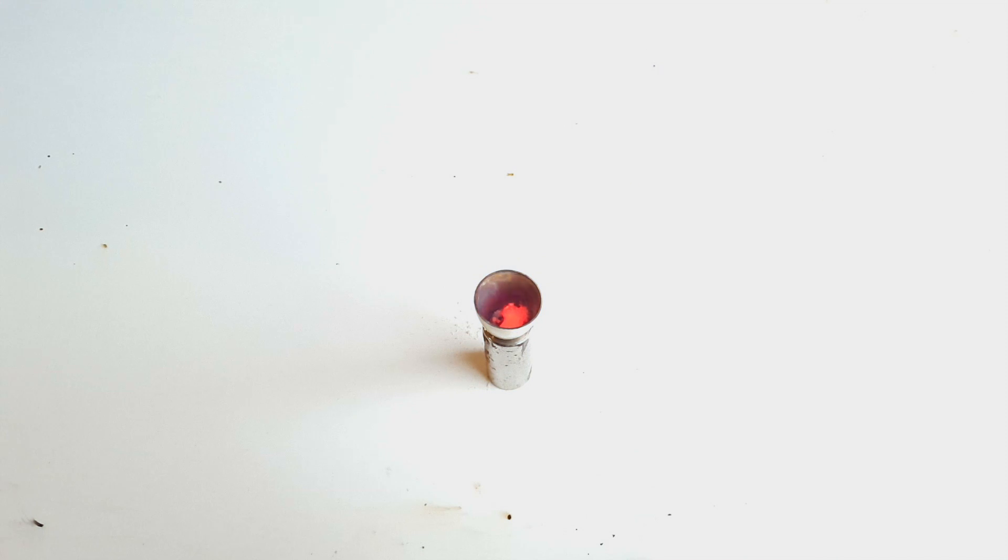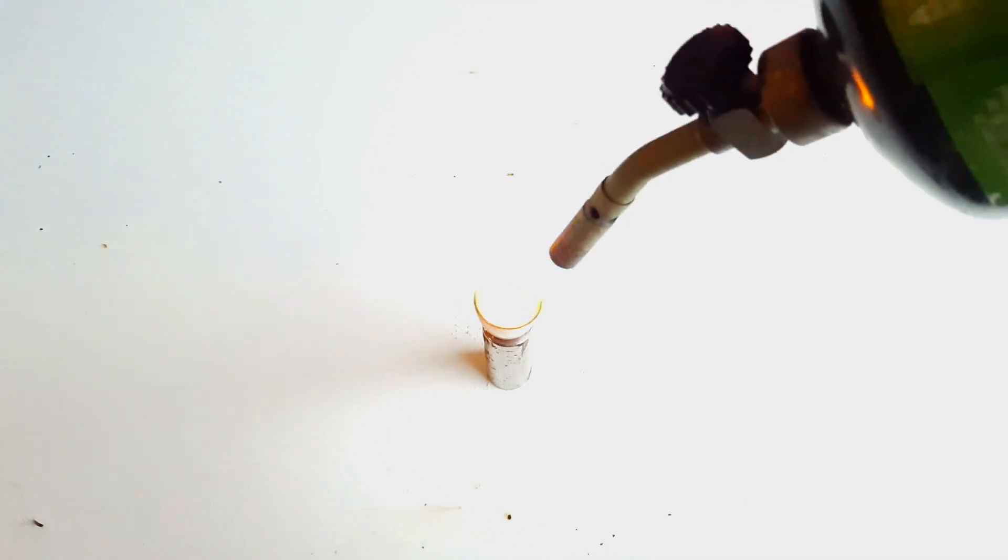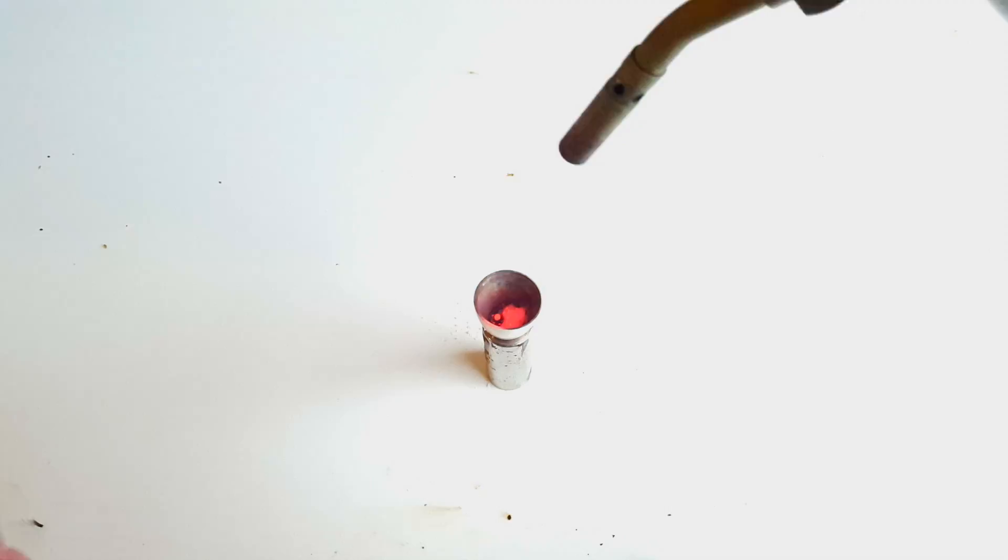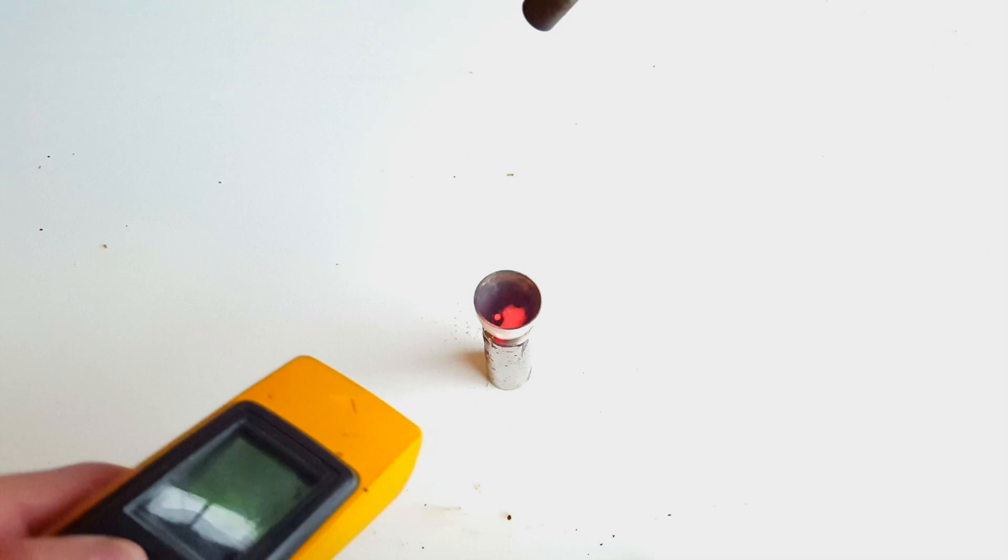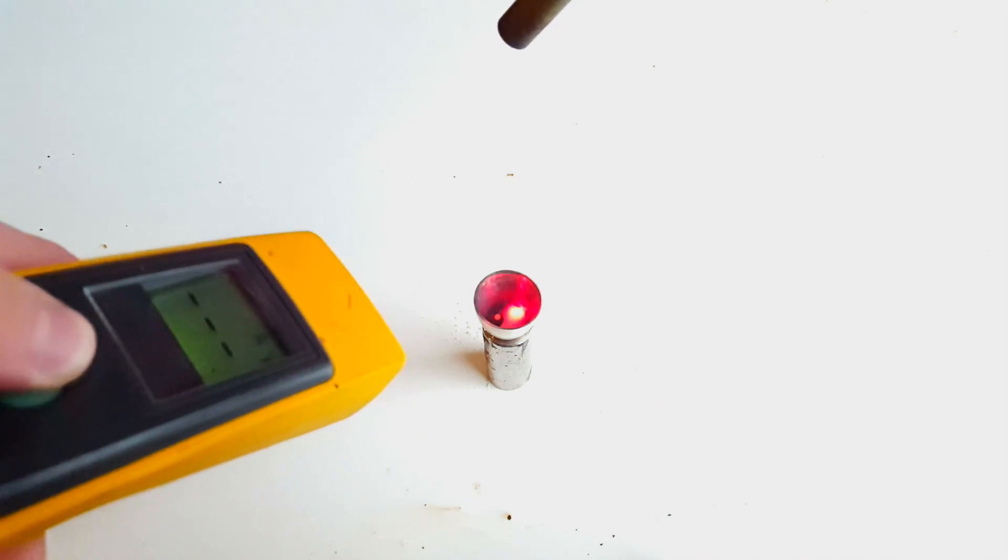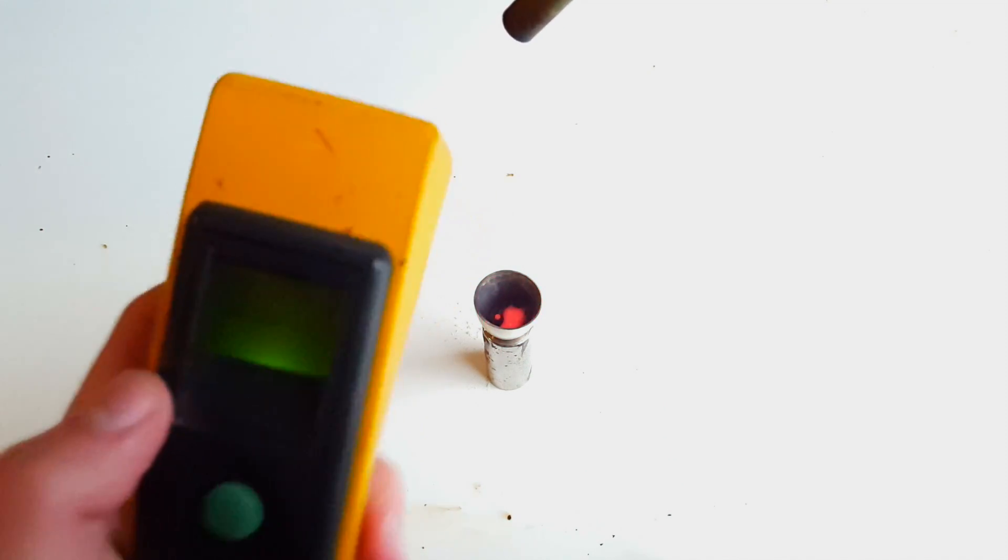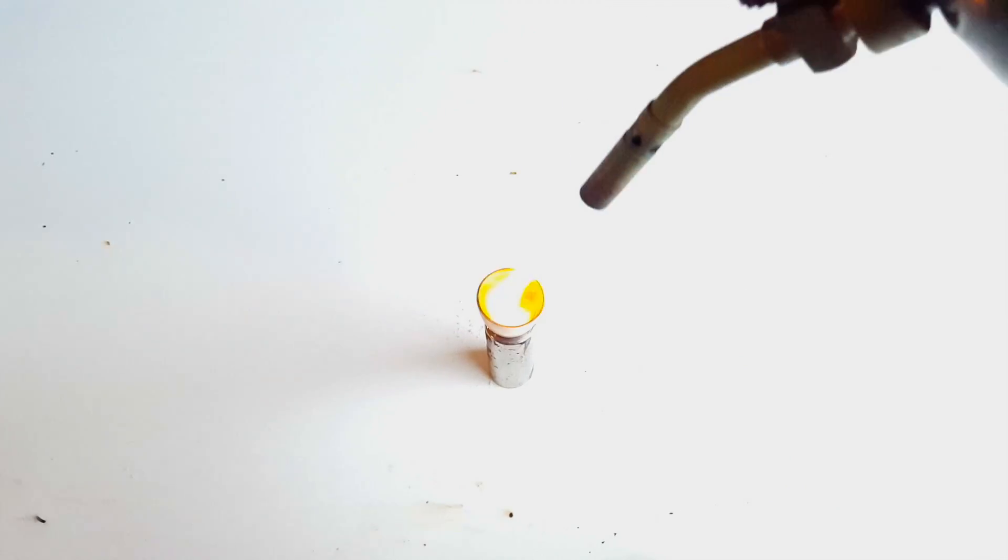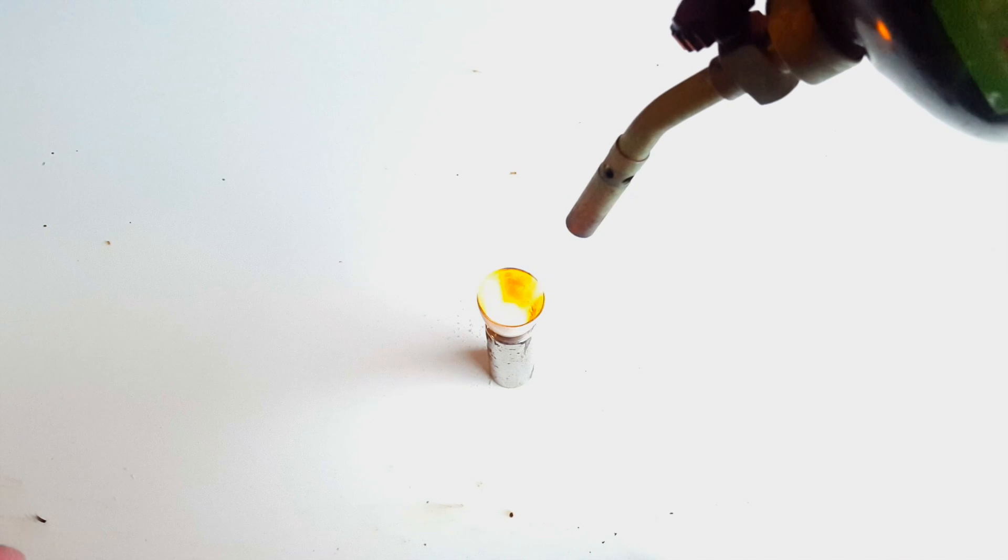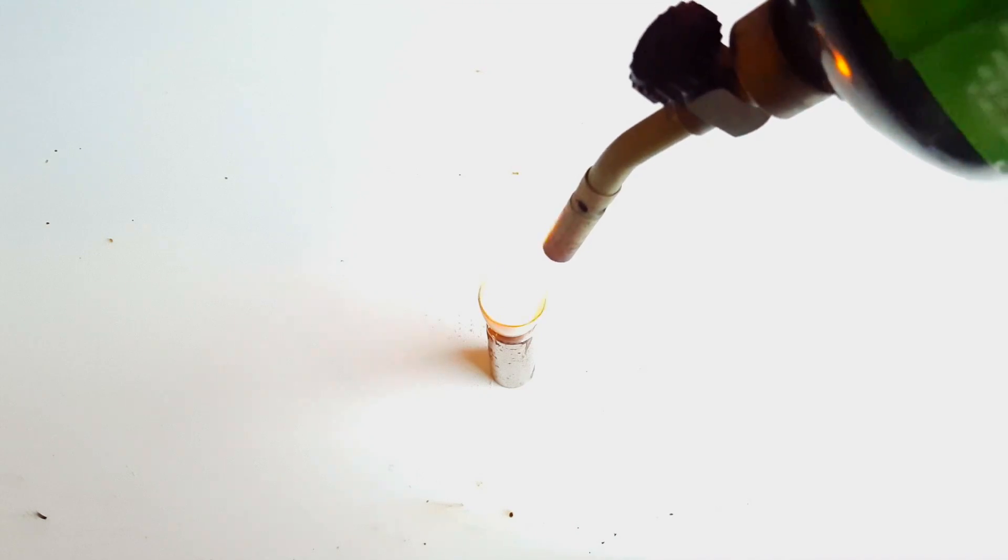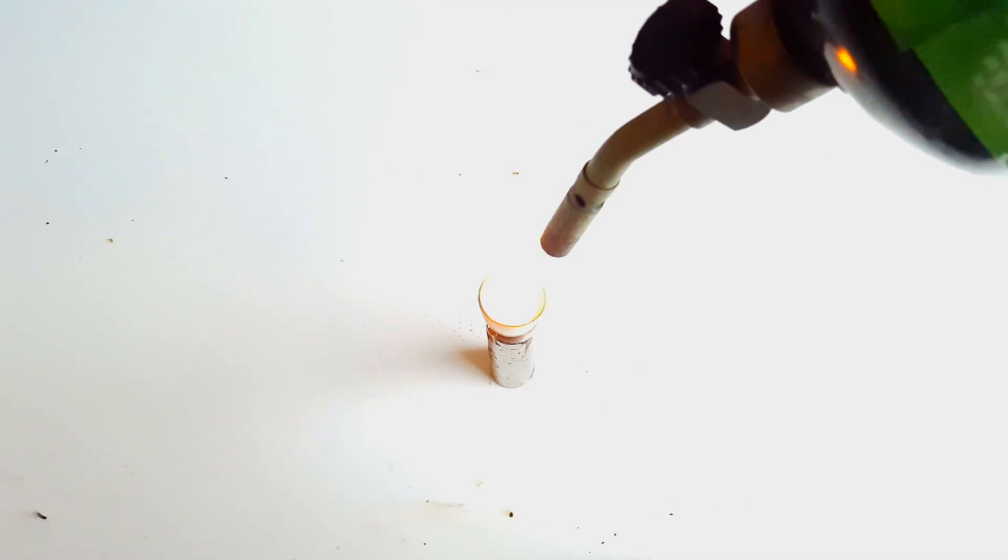As you can see, it turns a bright red, as well as gives off a large amount of infrared radiation when it's molten. I tried to get a temperature reading using my infrared thermometer, but it doesn't really measure such high temperatures. Anyways, after it was molten, I quickly dropped in the gummy.